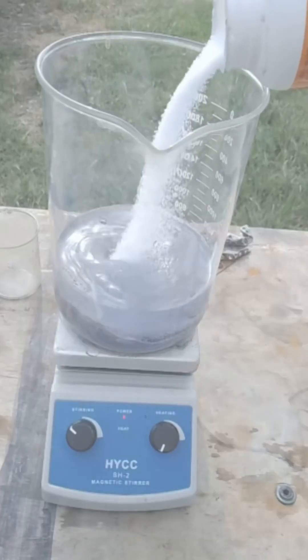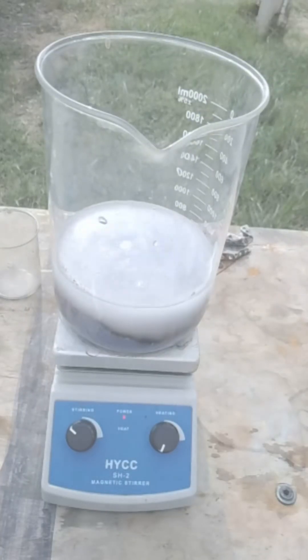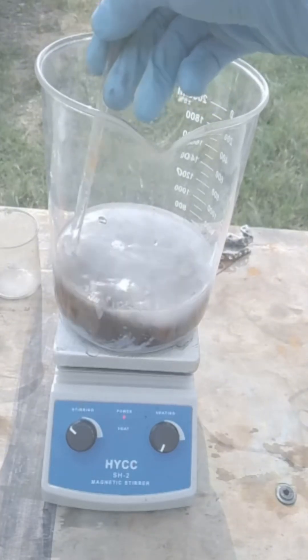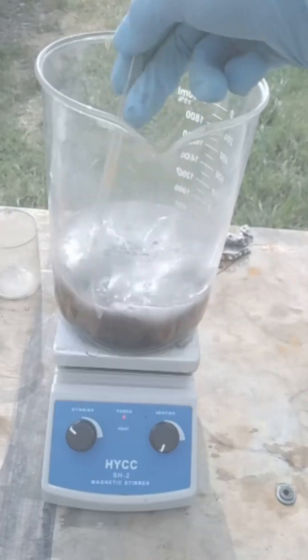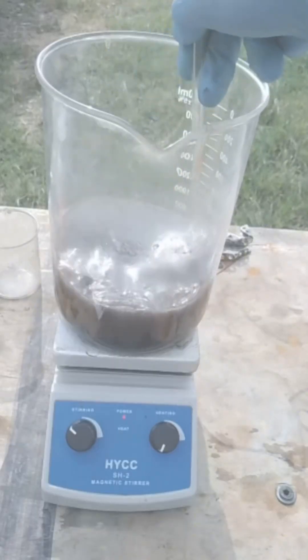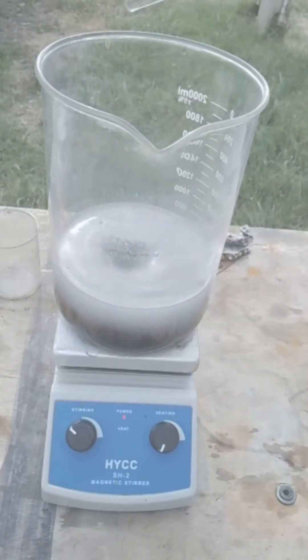Okay, so now here I'm going to be adding in some lye. This is just drain opener lye, so you can see the silver start turning brown down at the bottom. We want all that whiteness to go away, we want it to turn brown. And another thing guys, there's not really a ratio with this, you can eyeball it as well. You just want all the whiteness to turn brown, you don't want to see no whiteness in there. You want it to be dark brown or dark black, getting the blackish color.